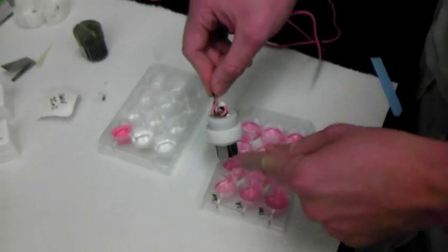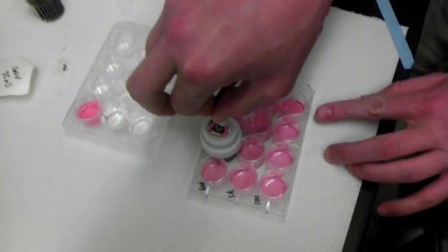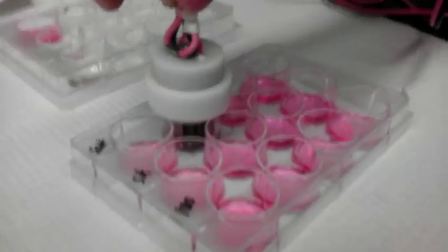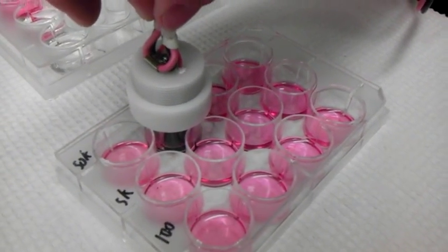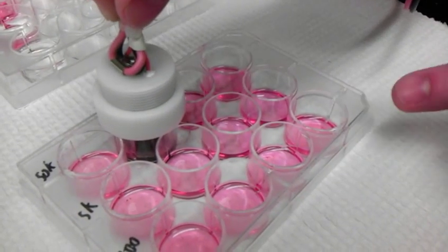So I'm not going to wash this in between these two samples because they're the same sample. But I want you guys to, you can bring the camera down close here and see the media down there. Can you see it? Okay. Now when I hit start, you'll see bubbles form when I do it. See the bubbles? It was quick. It's very quick.